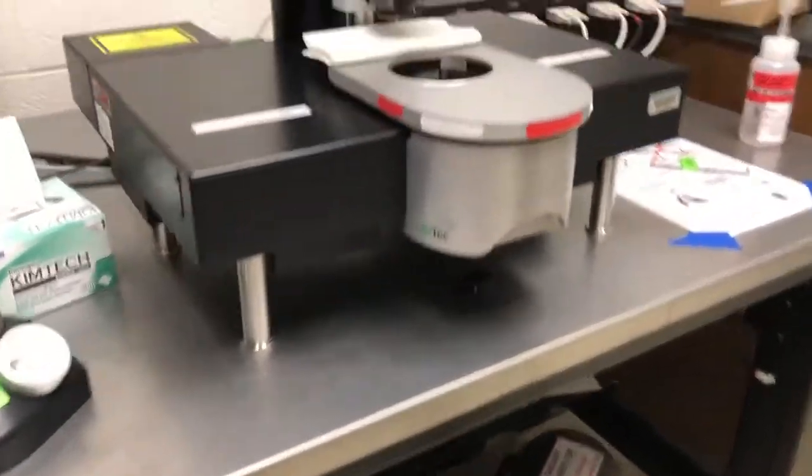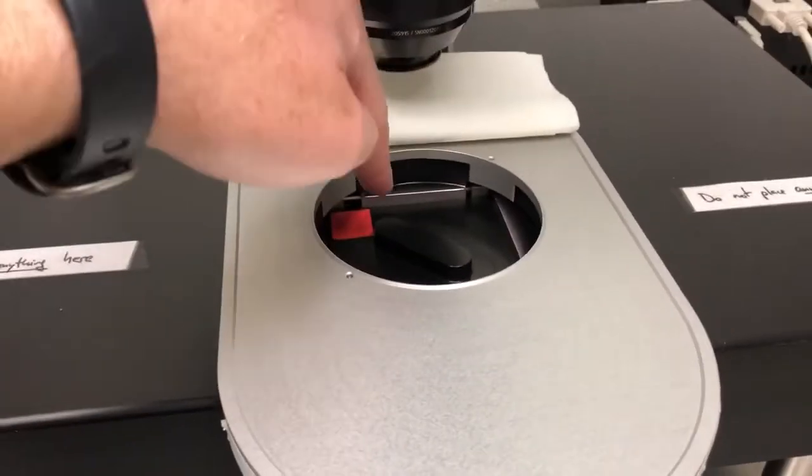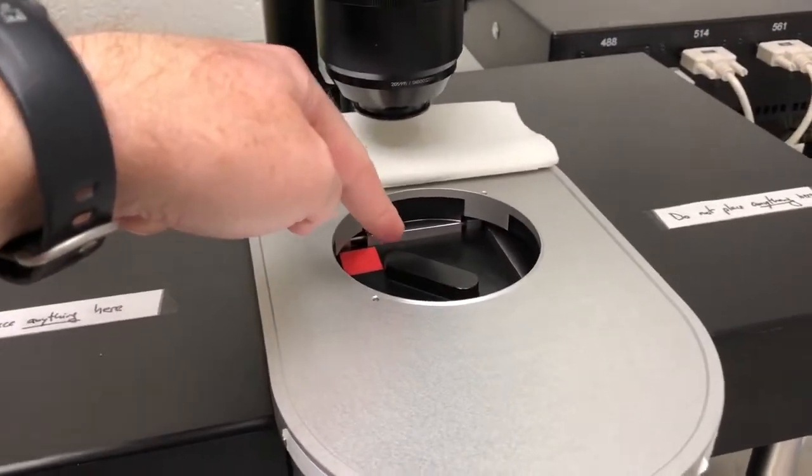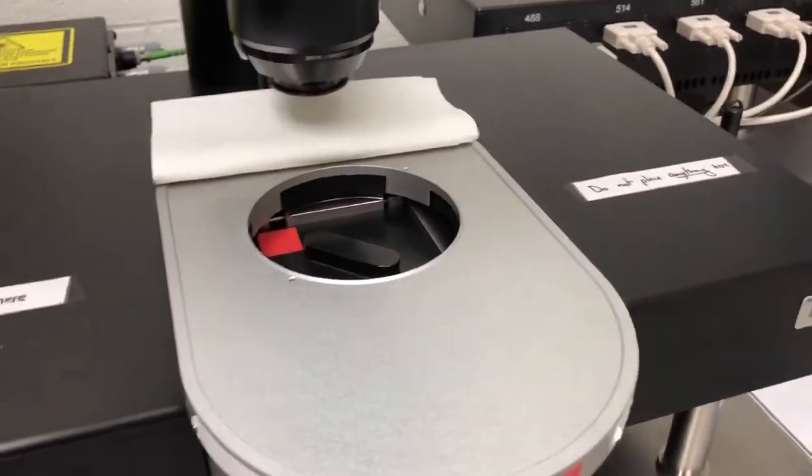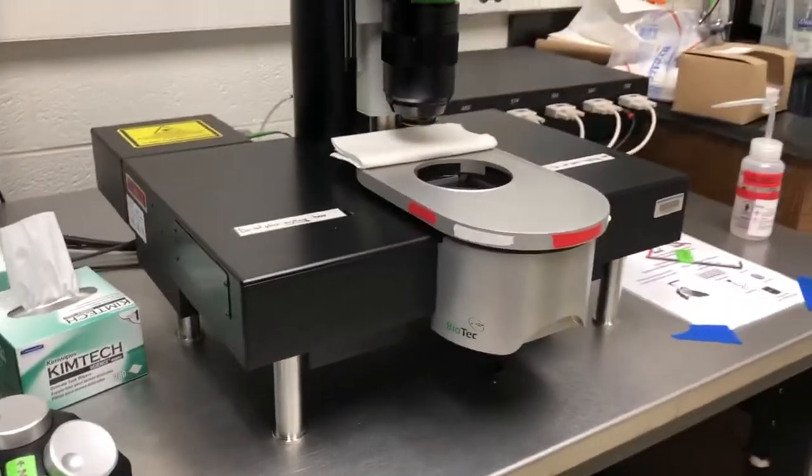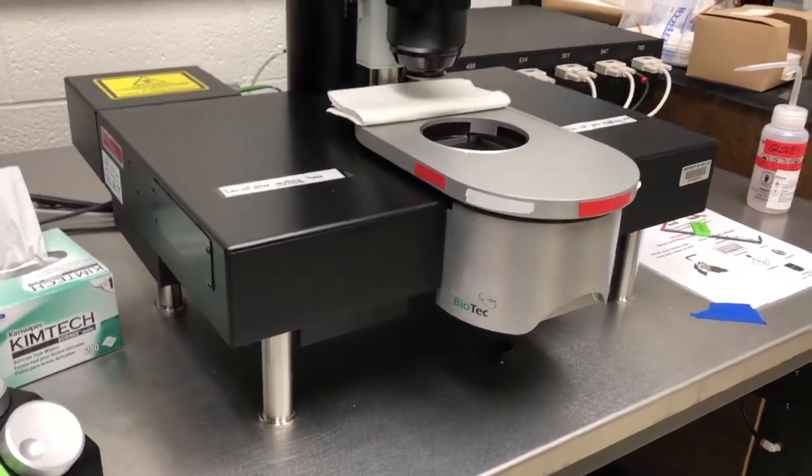Because if you bump it hard enough, this reservoir, which I will show you later, is filled almost to capacity. If you bump the table, it will slosh the liquid out of the reservoir and into what's underneath, which is a lot of very expensive optical and mechanical components. Please don't bump the table.